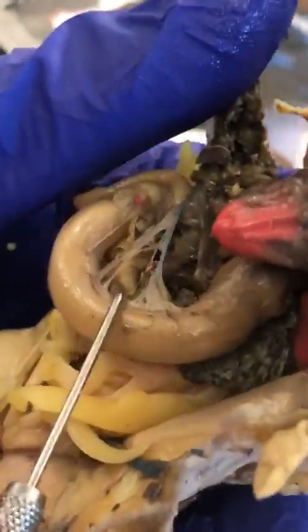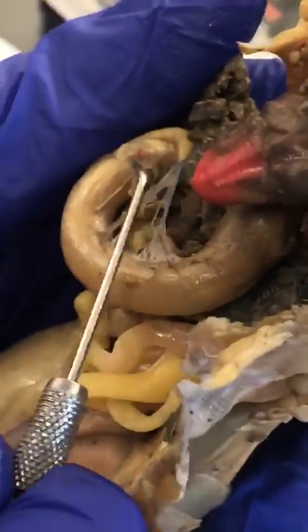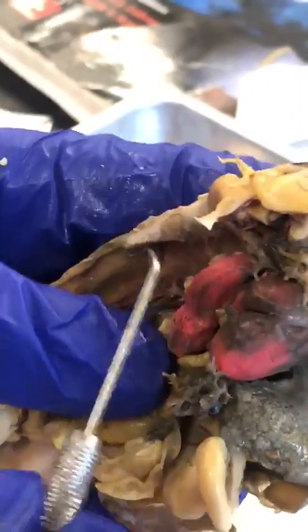We can't really see it. It's that big one right there. Which one? Oh, yeah, that's blue. Oh, so the red one was probably cut? Well, that might just be lung. Oh, okay, well, it would be there. Actually, it might be that. Whatever. It's where the gastric should be. The stomach. Yeah, gastric stomach.